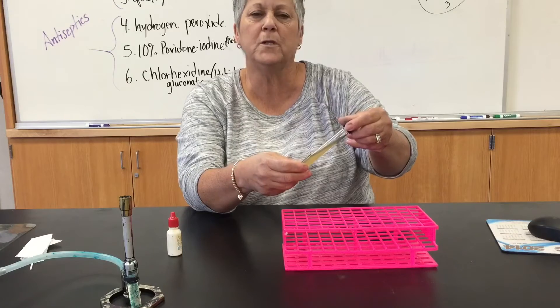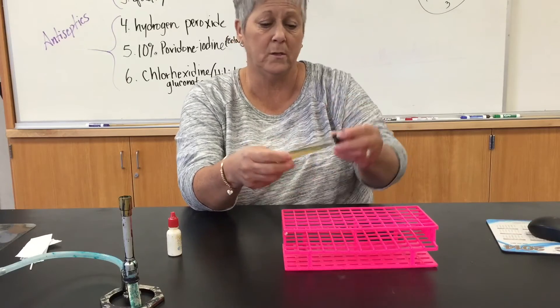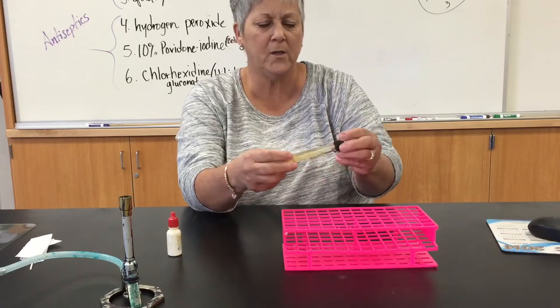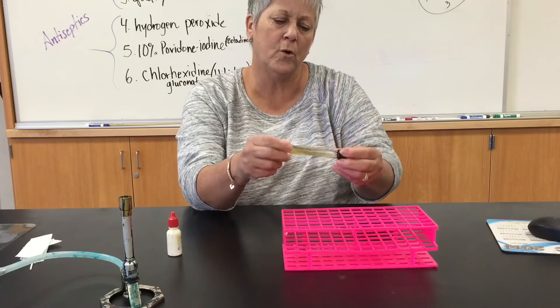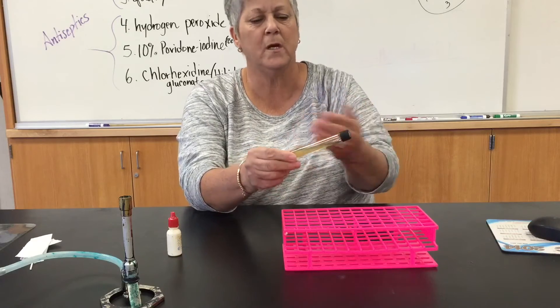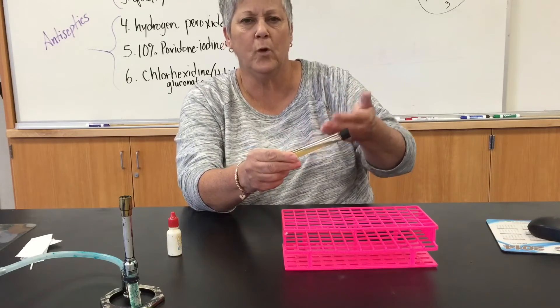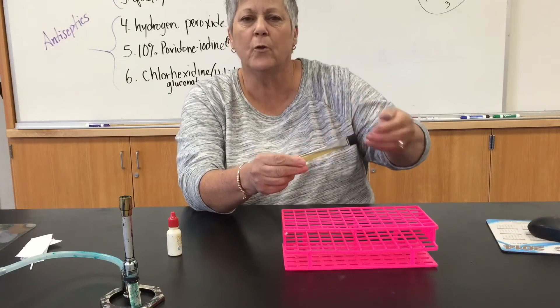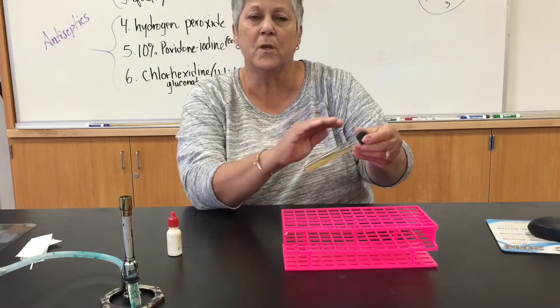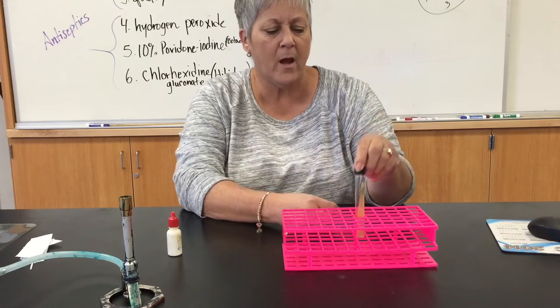Now the ferric chloride solution is bright yellow, so the bright yellow doesn't have anything to do with the reaction. I just kind of rotate the tube like this, trying to get the ferric chloride to loosen the growth that's on the slant so that the ferric chloride can come into contact with the slant.